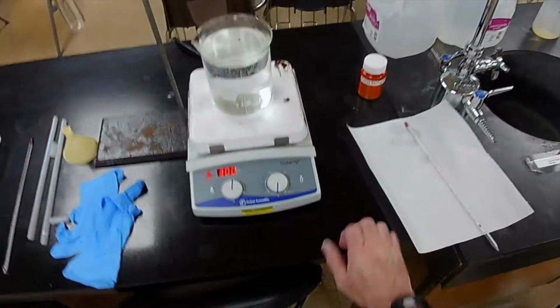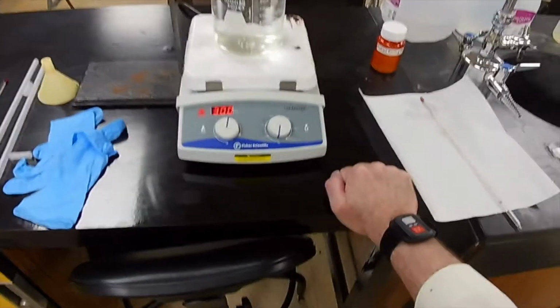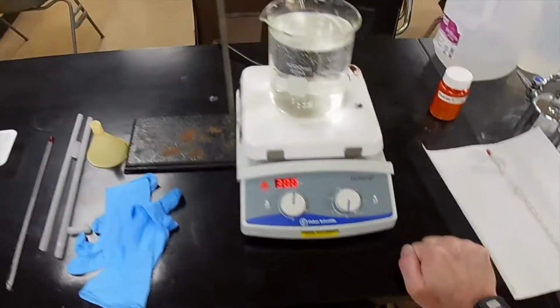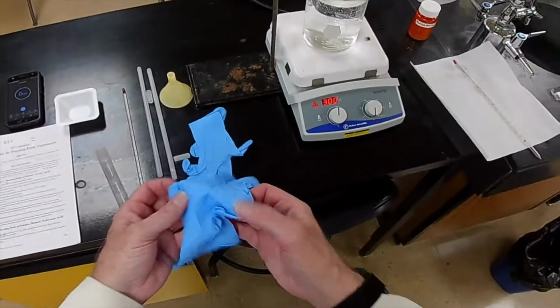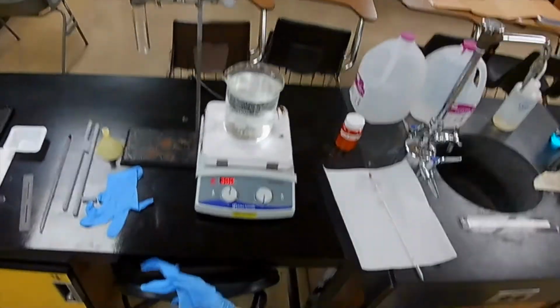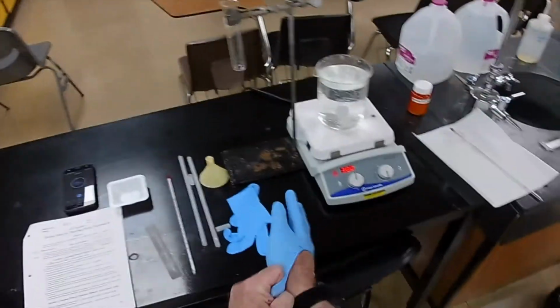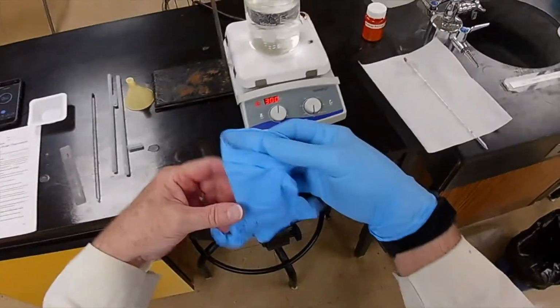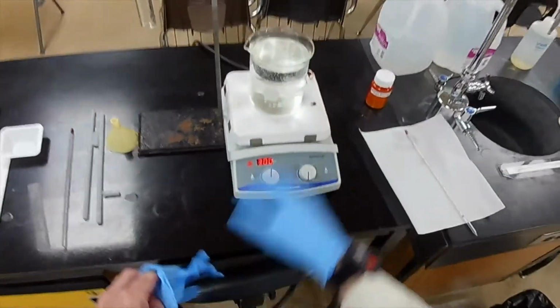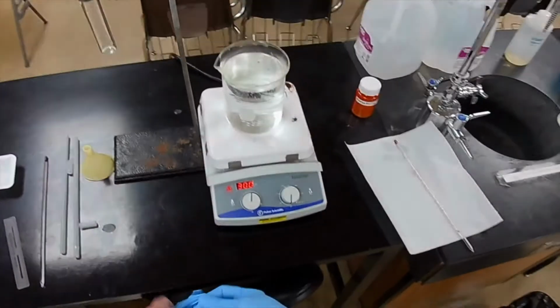You may notice also that as the water heats up, we're generating gas bubbles. But I just measured the temperature at 70 degrees. It's not hot enough to boil, so where's that gas coming from? It's dissolved gases in water. Gases will dissolve in liquids, and when you heat them up, for most gases in liquids, they become less soluble. So as you heat up the water, the gas comes out of solution as tiny bubbles. And all of that will have proceeded to completion. We will have degassed the water before we reach a temperature of boiling.